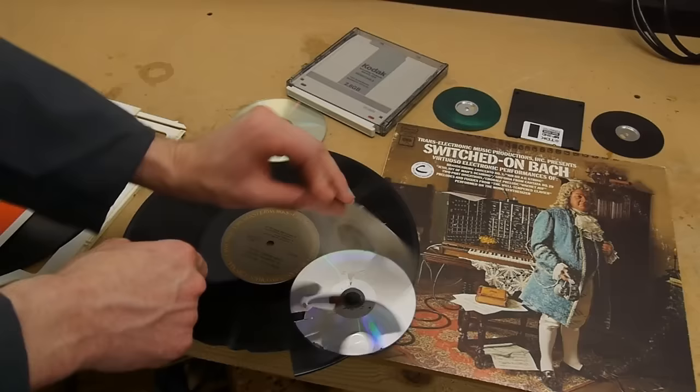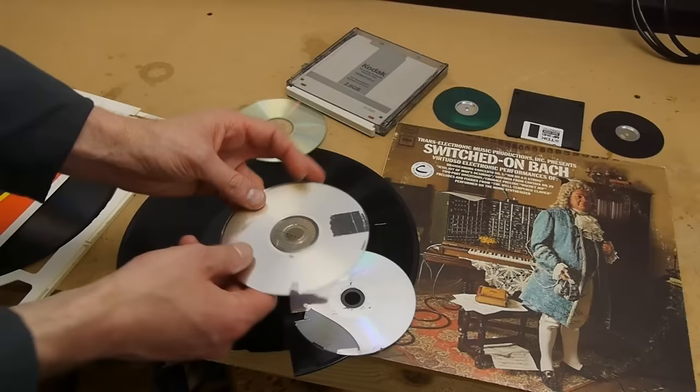So if we put this into the SEM either side up, all we'd see is a smooth surface because there's actually no bumps on the surface. That's good, because it protects the media. So I spent a long time trying to figure out how to expose the aluminum part.